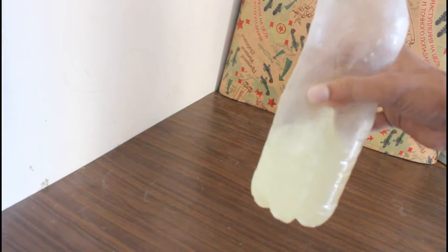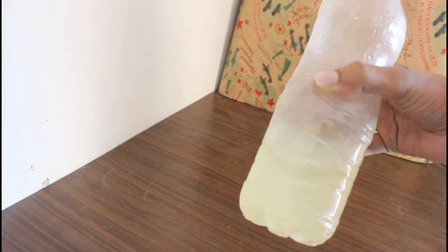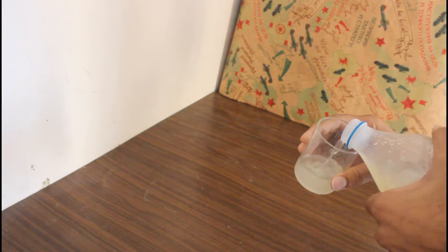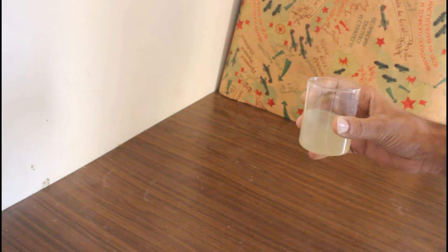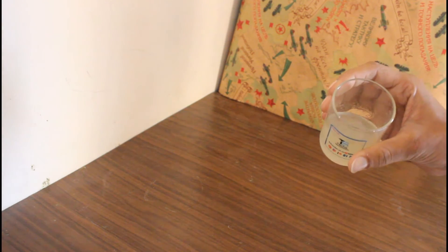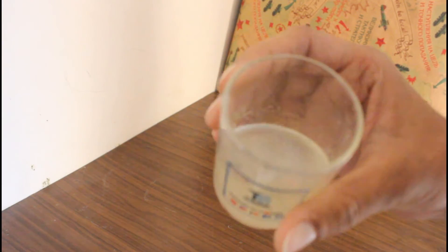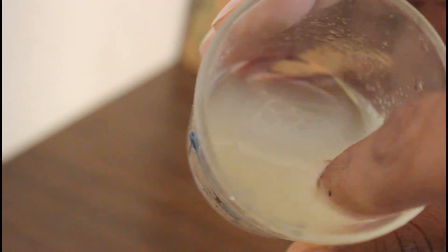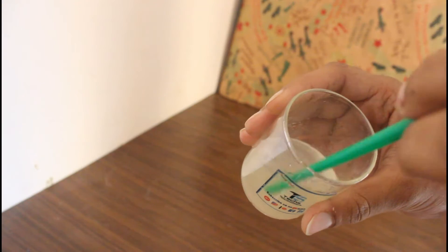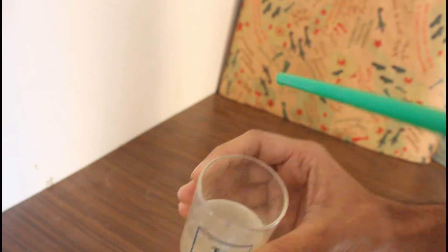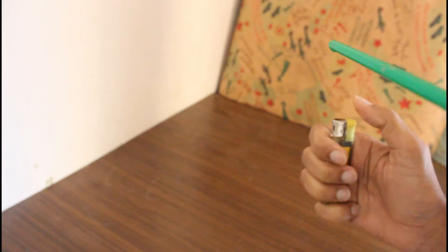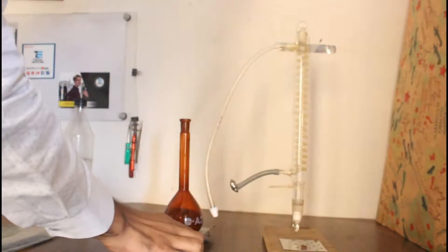So here in this video I will be doing a distillation of this unknown compound. It is having some flammable compound, maybe the ketones or the alcohol. It's a little bit oily. Let's see if it is flammable. Yes, you can see it's quite flammable.